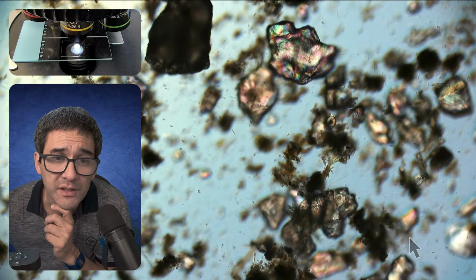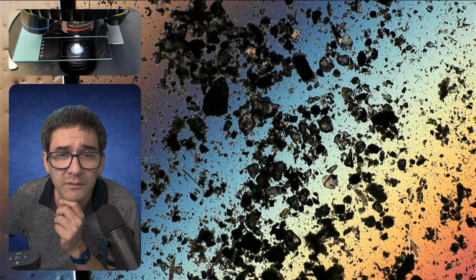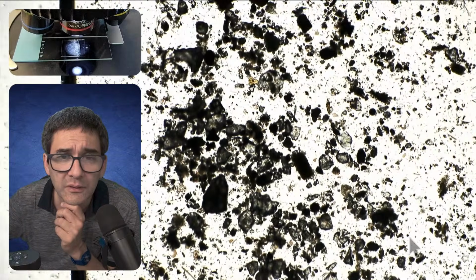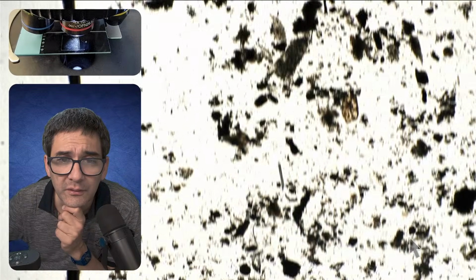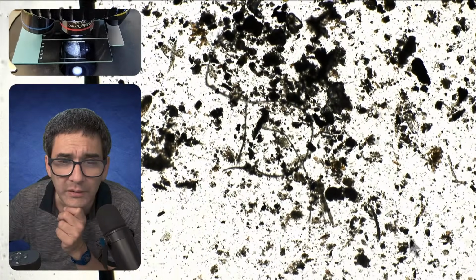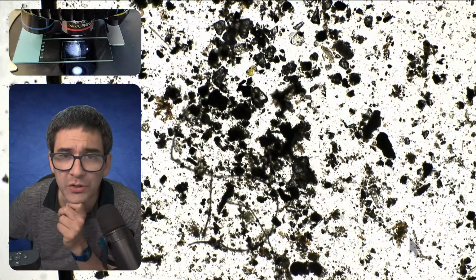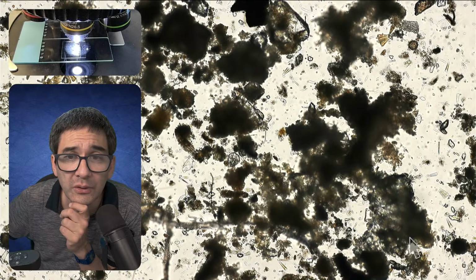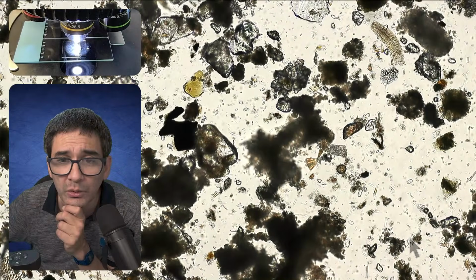But I already see that this does not seem to be a very interesting sample. Oh, but it's also something where we learn something. If a sample looks like this, then normally what I usually do is I do a time lapse, because usually there is more life present than what you would assume, but you just don't see it because the movement is too slow. Yeah, I mean, occasionally, but this is indeed more on the disappointing side.